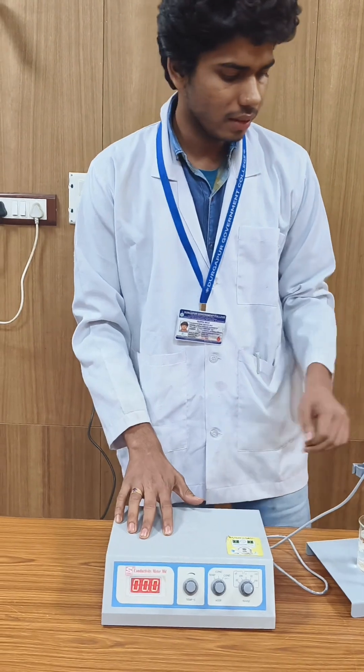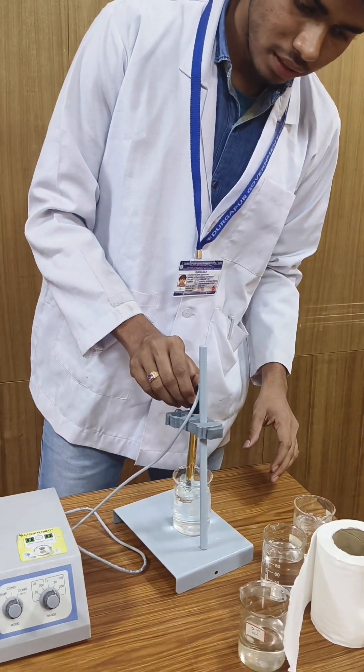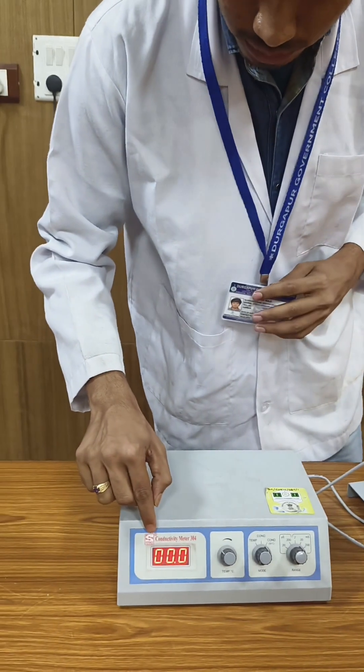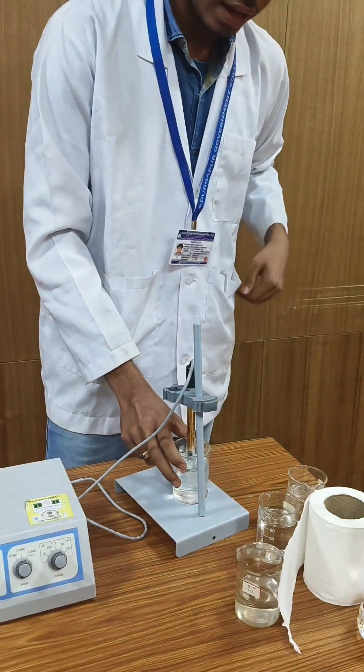This is the electroconductivity meter with the electrode dipped into distilled water. You can see the measurement of conductivity is zero because distilled water has no ions present.